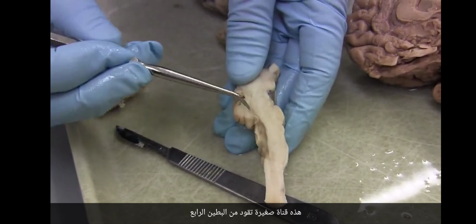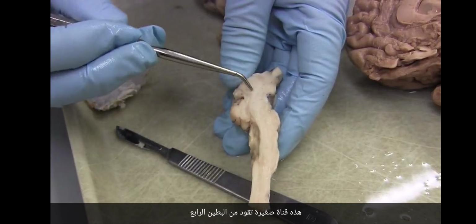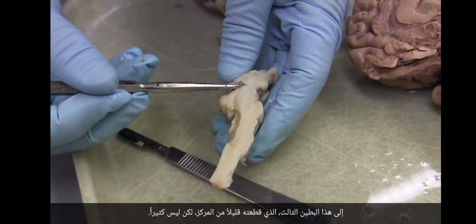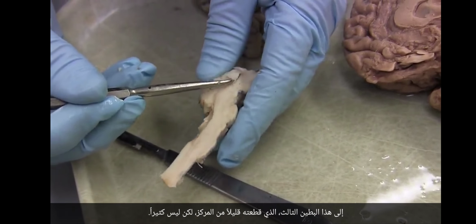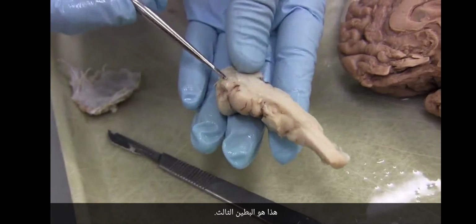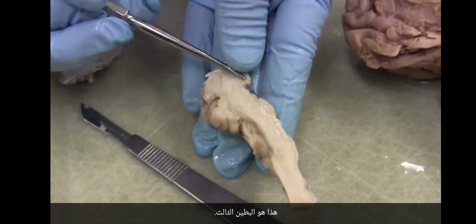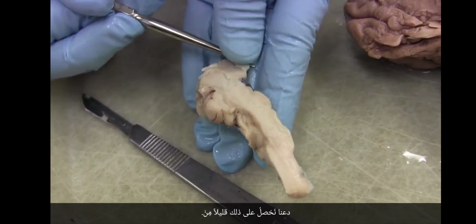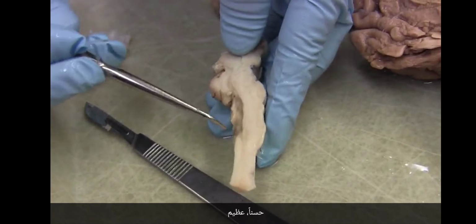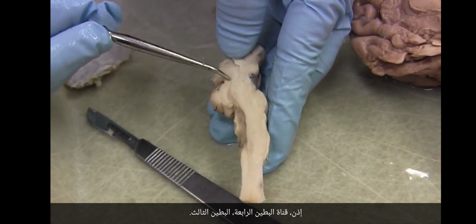That's a little channel that's leading from the fourth ventricle up here to this third ventricle, which I cut a little bit off center, but not much. This is the third ventricle. Let's get that little bit off. Okay, great. So fourth ventricle, aqueduct, third ventricle.